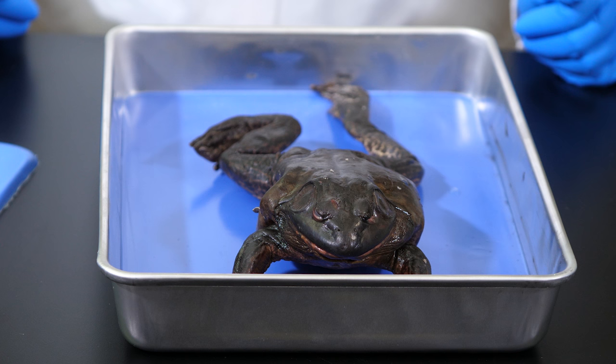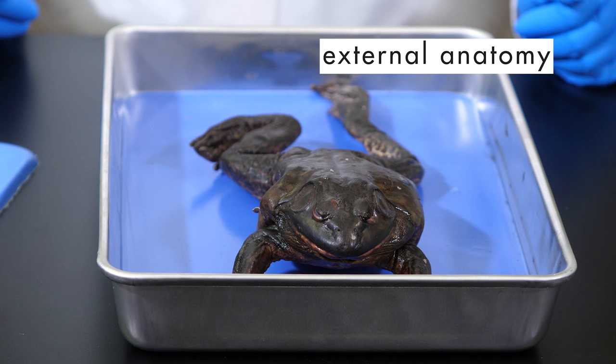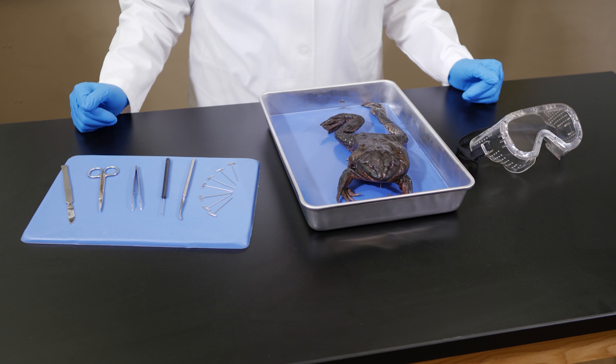We can also examine some of its external organs, such as its mouth and eyes. These are all aspects of its external anatomy.